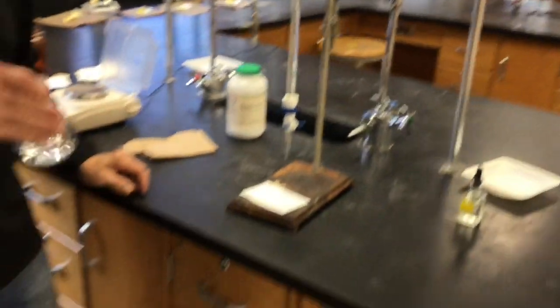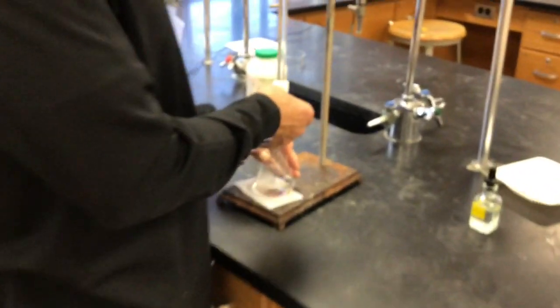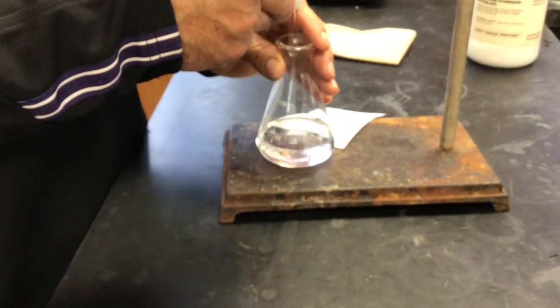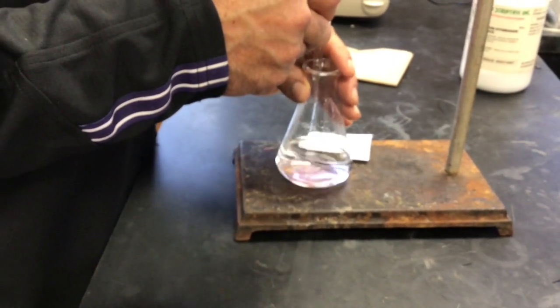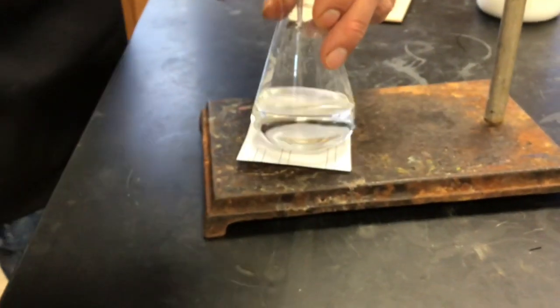Okay. So what did we say? It was about 10 milliliters, right? It was fast and sloppy, yeah, a little bit more than 10. So I'm going to run in a good 8 milliliters here. I can see it, there it is. Why Mr. Moore allows the blind guy to do this is beyond me, but, you know. You're doing great. Okay, there's about 8 quick ones. Now let's see if that color can go away. Good.